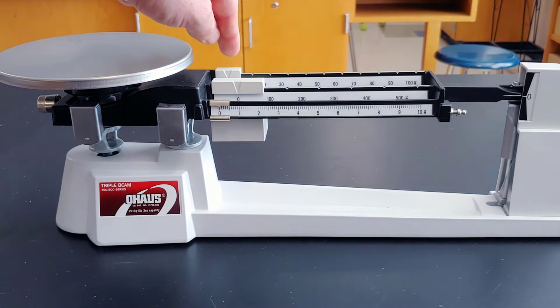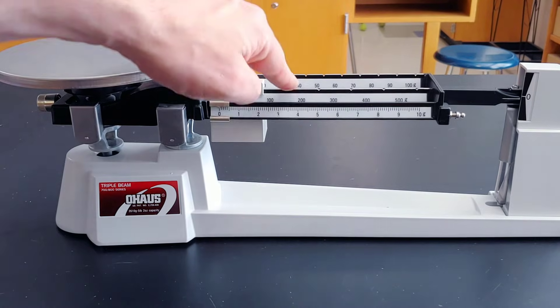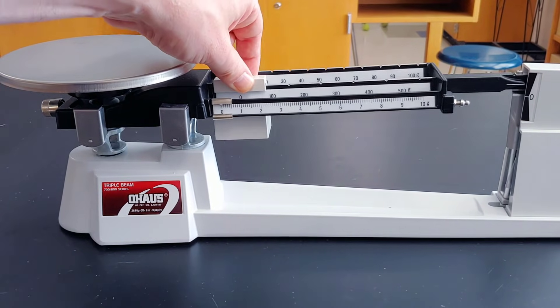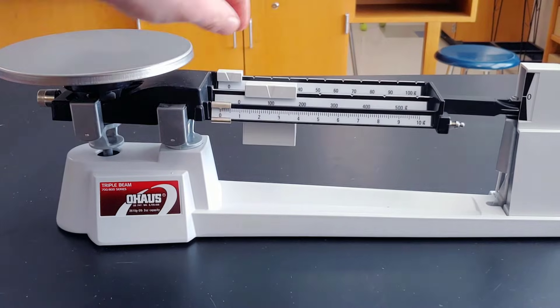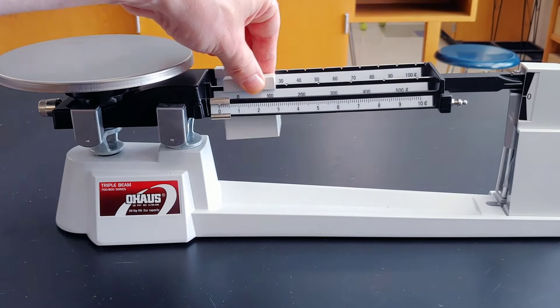When moving these two biggest weights, you can see that there are grooves. You want that weight to rest in that groove. Otherwise, you're not going to get an accurate measurement.